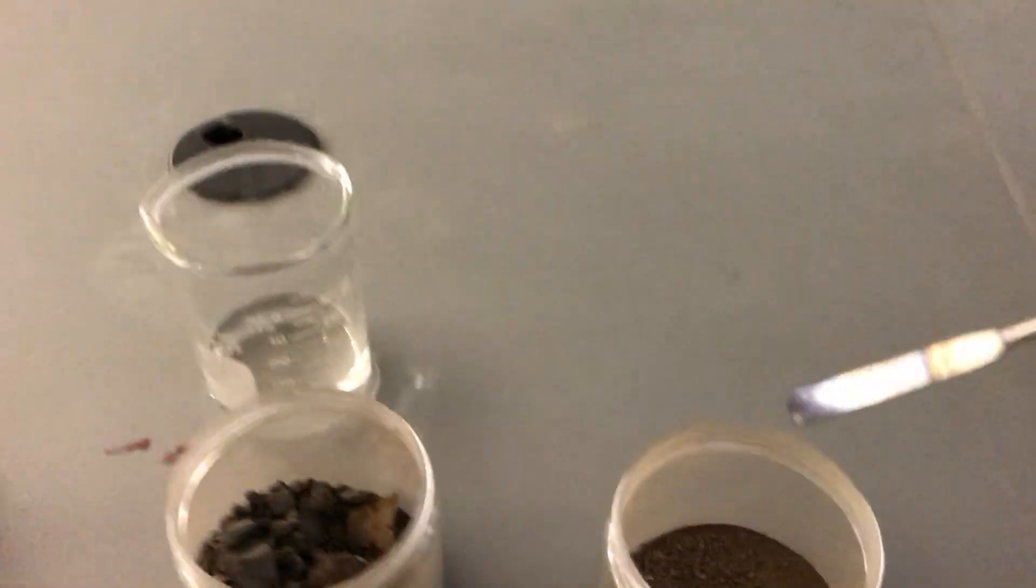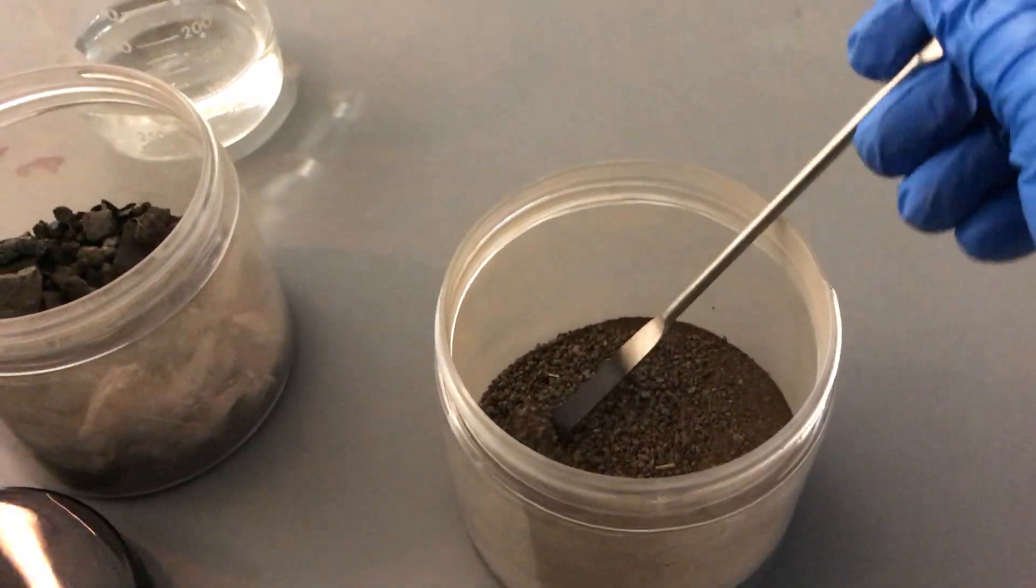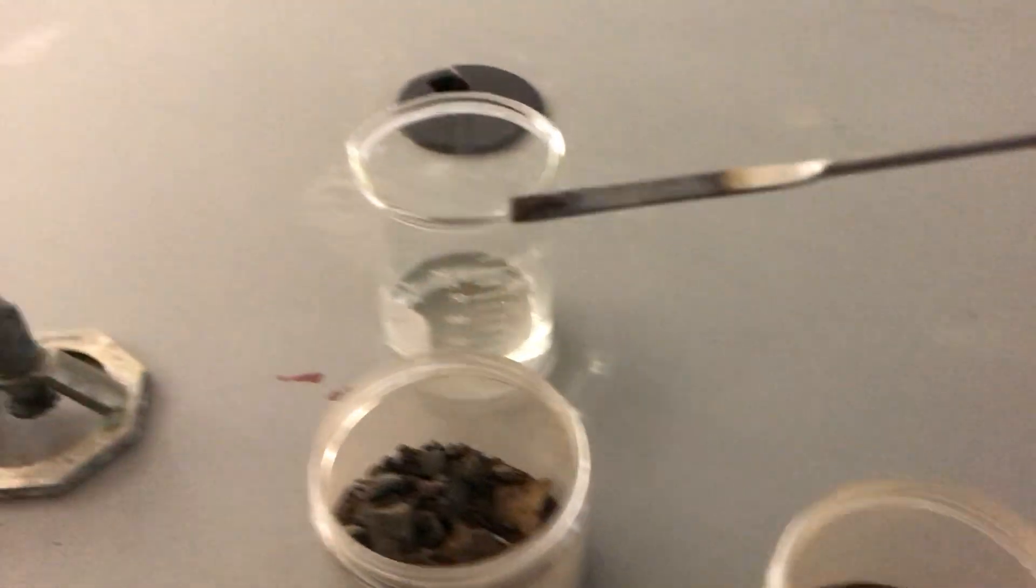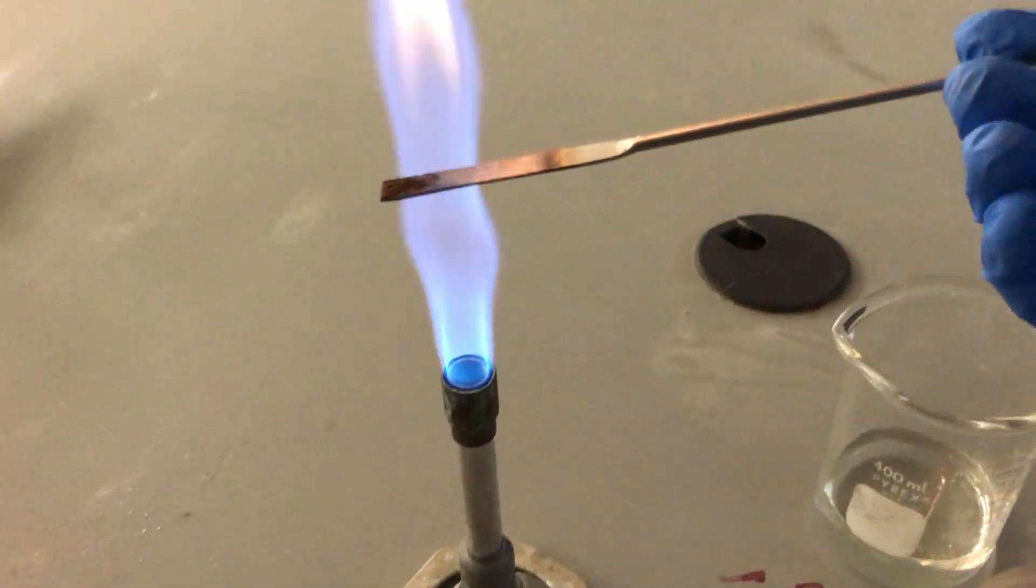And then we're going to introduce it and pick up a few granules of our suspect sample. So once again we're going to reintroduce this to the flame.